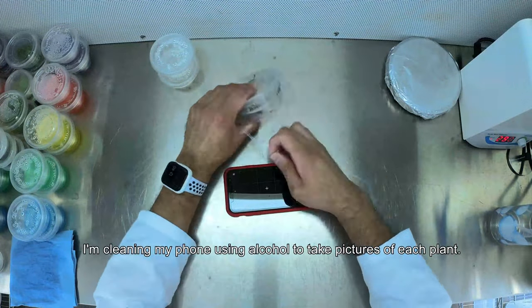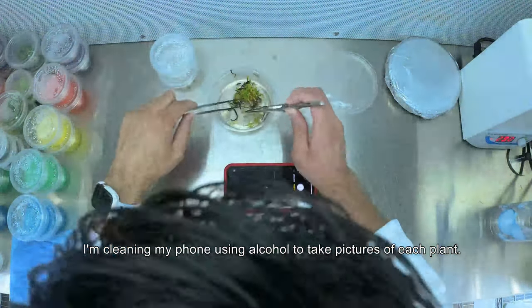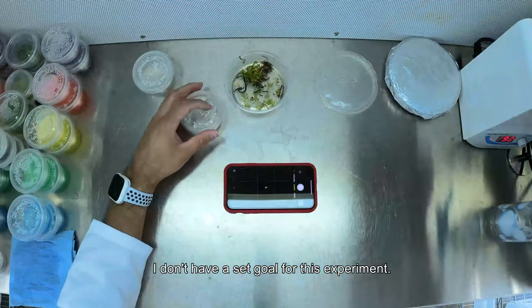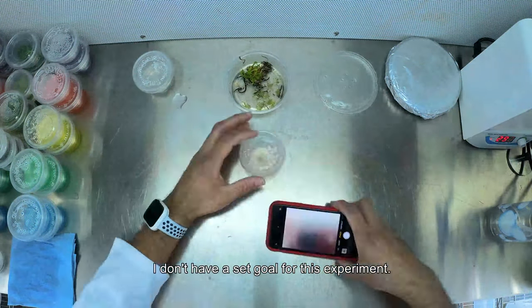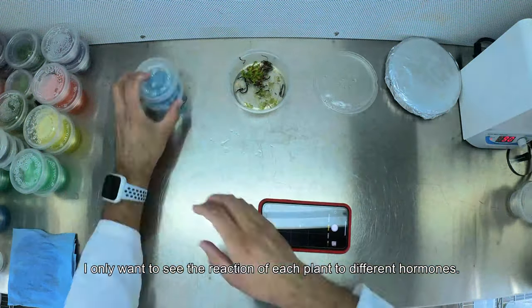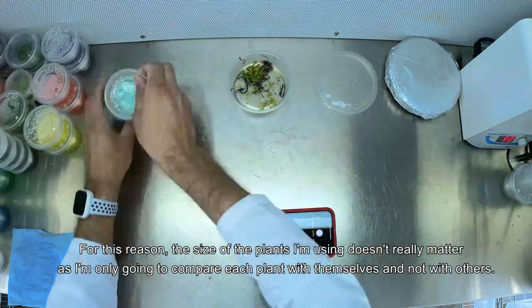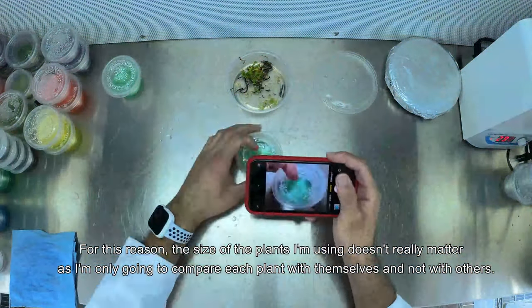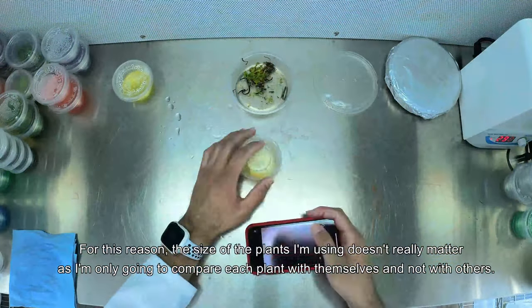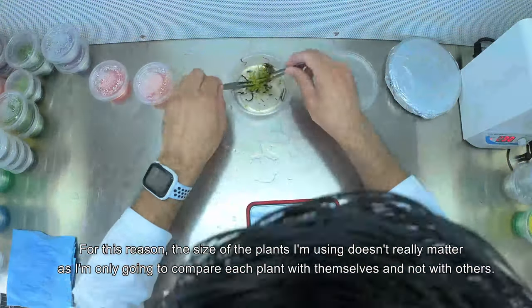I'm cleaning my phone using alcohol to take pictures of each plant. I don't have a set goal for this experiment — I only want to see the reaction of each plant to different hormones. For this reason the size of the plants doesn't really matter, as I'm only going to compare each plant with itself and not with others.